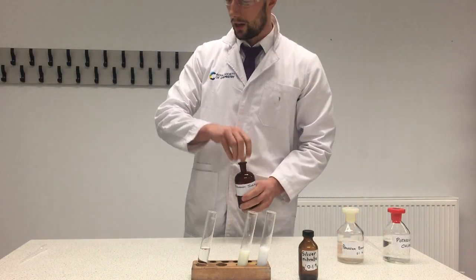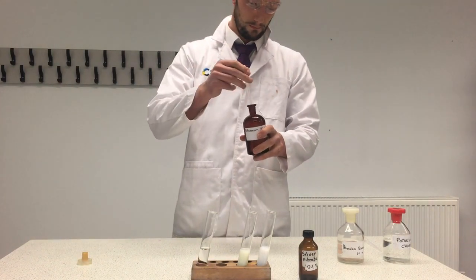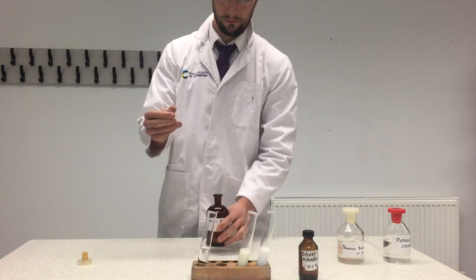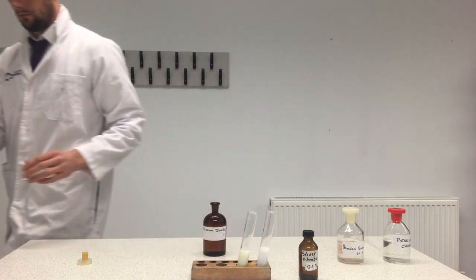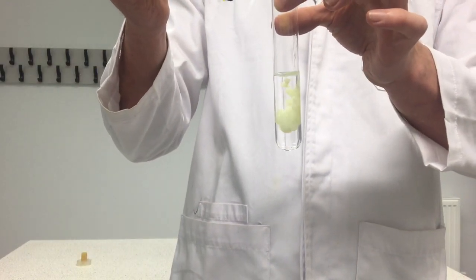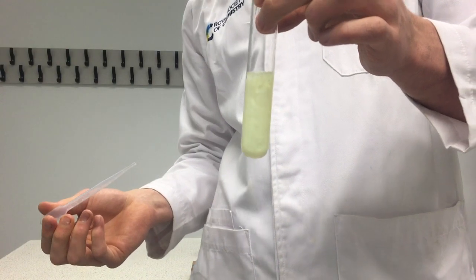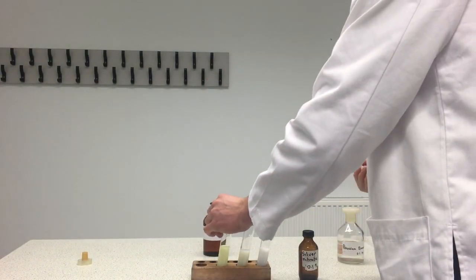Finally, potassium iodide. Here's the boiling tube — let's add the potassium iodide in. Again it's going milky or cloudy, but this time it's yellow.